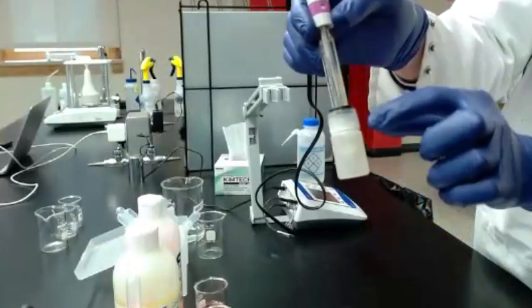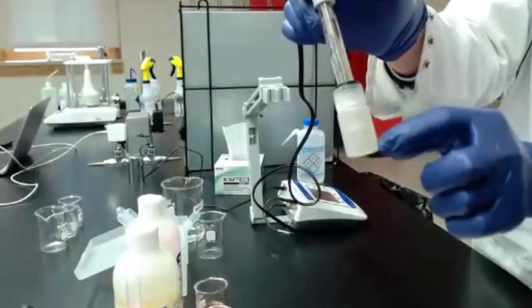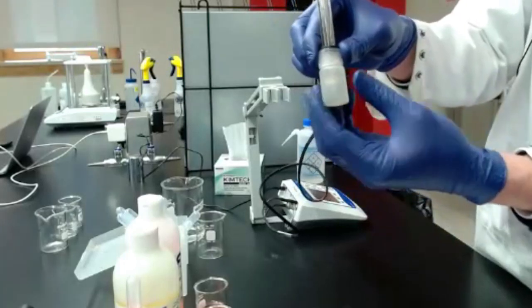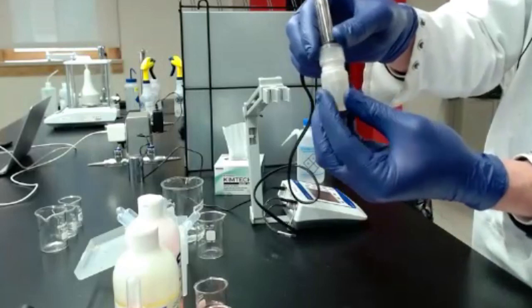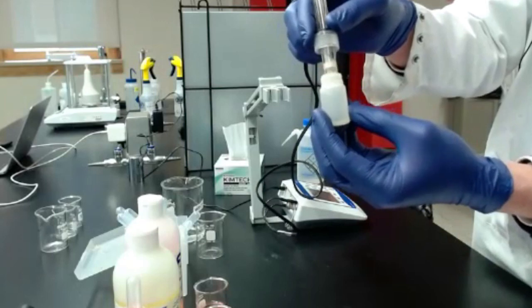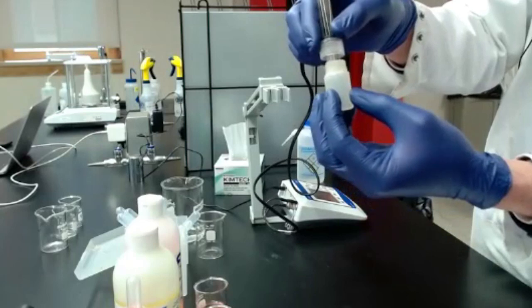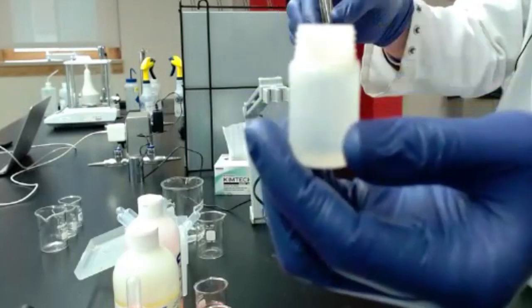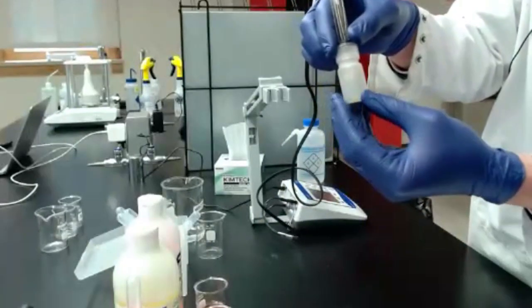So I mentioned the different solutions that we use with pH probes earlier. So the storage solution is the one in this little vial, and that's what I'm going to go ahead and take off right now. And you want to make sure when you're storing these that they're clean. You don't end up with any mold in the little vial. You know, crystals, they're not the end of the world. Potassium chloride will crystallize. I've got some on the edge of my vial here, but making sure they're nice and clean and then full as well.